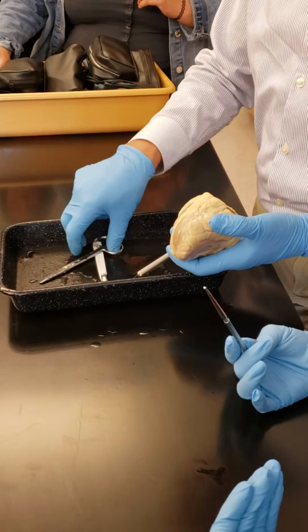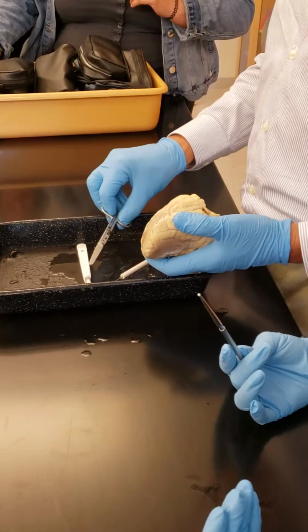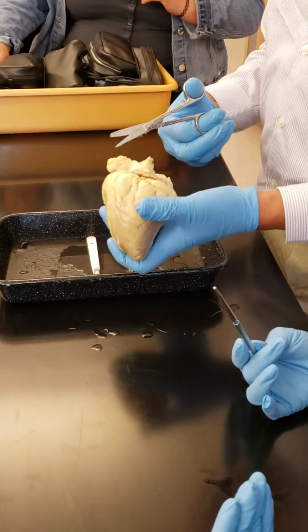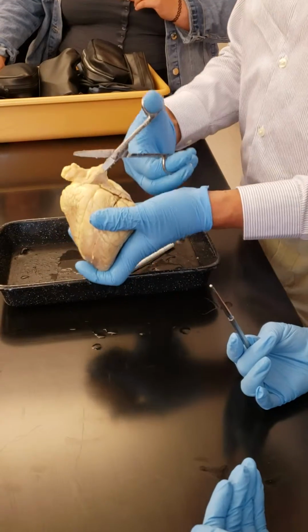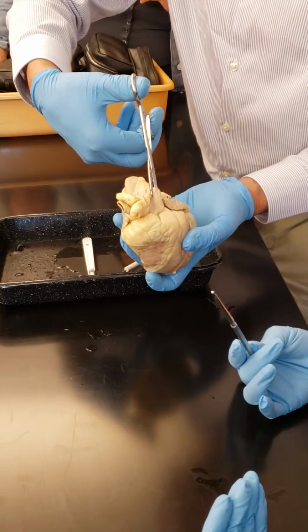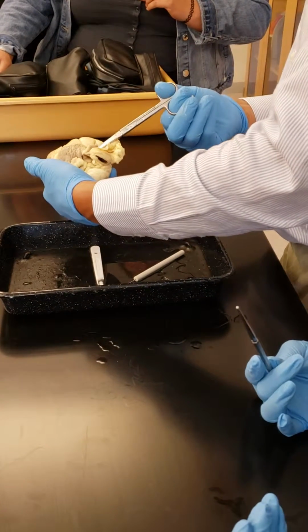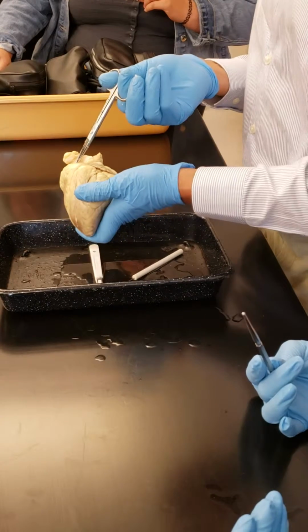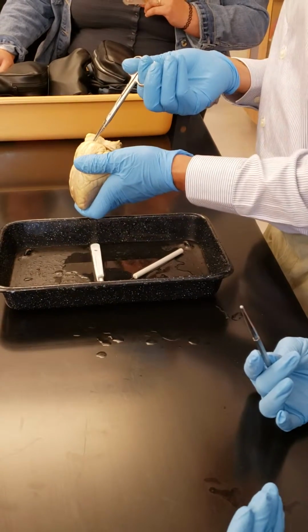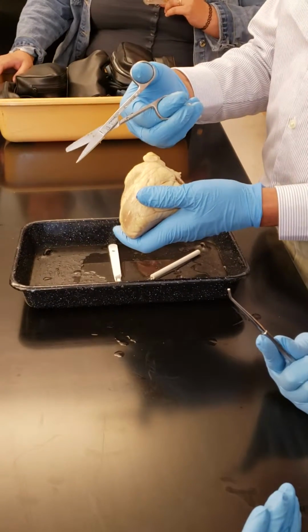And the semilunar valves, one is pulmonary, and where's the other one? Aortic. Do you still remember that from this blood vessel here? On the top, see that I'm holding like this. This is the pulmonary, right? So as long as you know this, the pulmonary valve is right here, where it starts. There are 3. So when I cut, I will cut one of those 3, right?